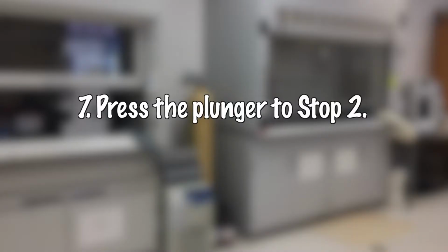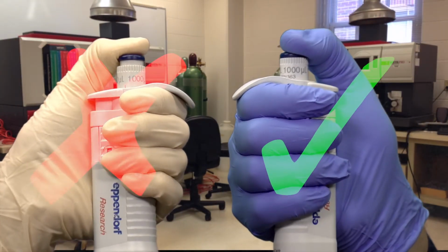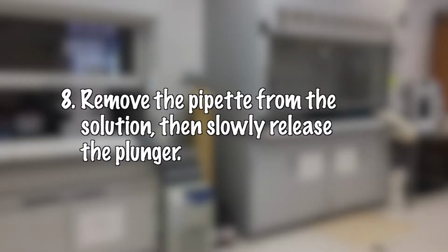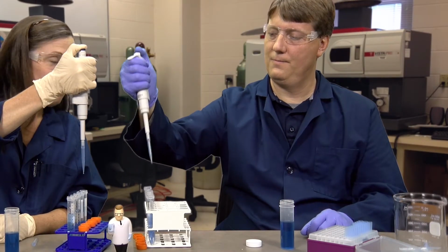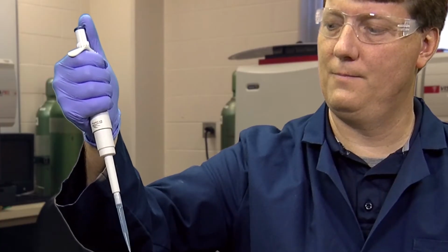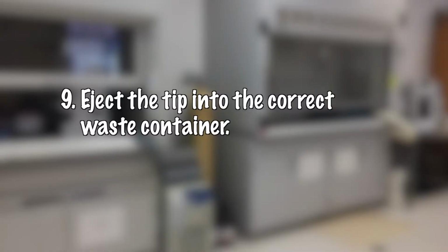Step 7. Press the plunger to stop 2. Step 8. Remove the pipette from the solution, then slowly release the plunger. Step 9. Eject the tip into the correct waste container.